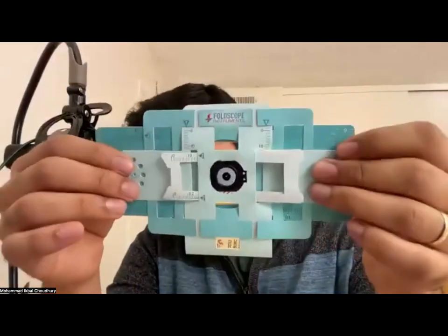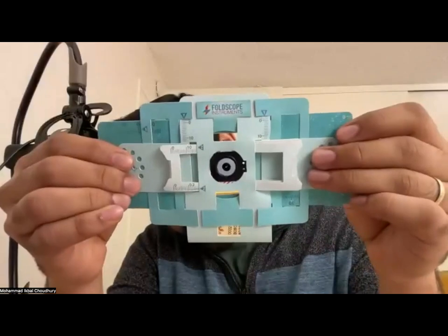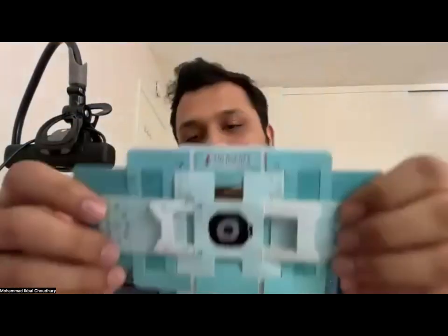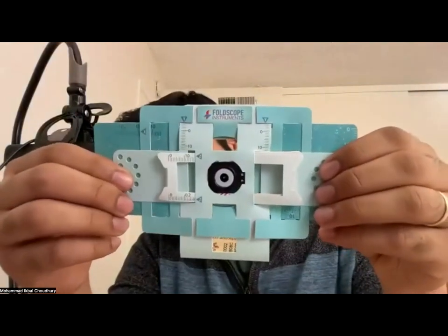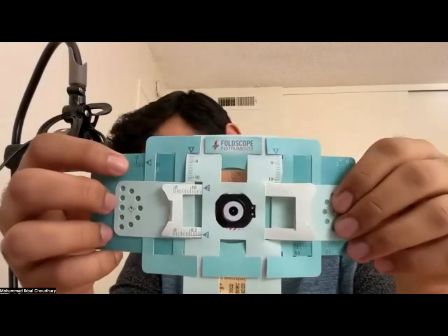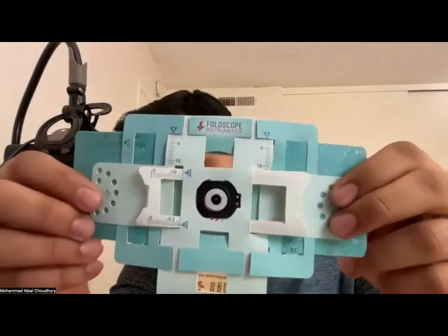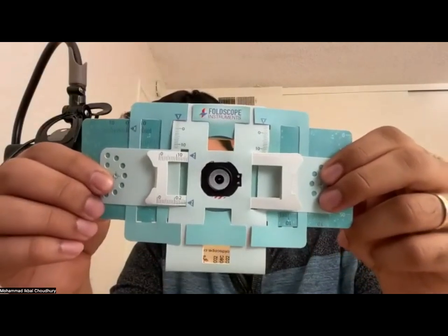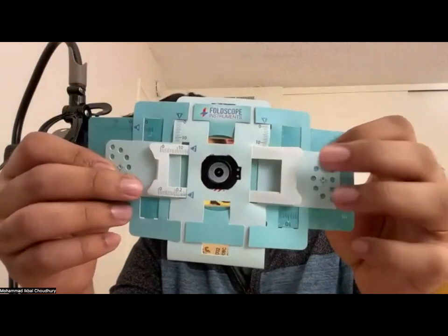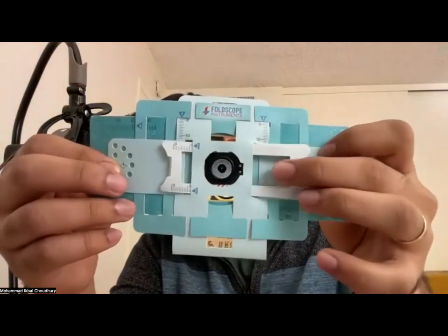So if you hold it like that, you should be able to go up and down like that. That's your y-axis. And then you can move in the x as well. So there's a bit of scale here that you can follow, if you want it to be precise, as in how much x and y I'm moving. And there is a paper wedge here so that you can move like that, right?